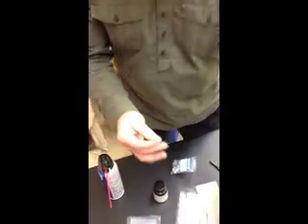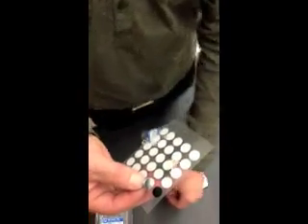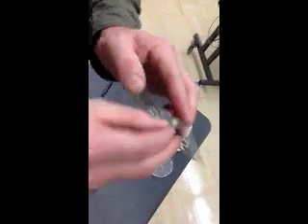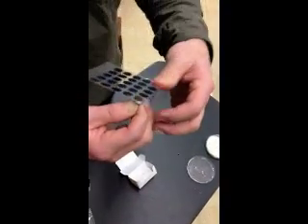One of the techniques is called the carbon tape. You'll take the first layer off. You'll have the carbon tape on one side of the sticky area — it's sticky on both sides. You'll press it down, make sure it's centered over the stub as much as possible, push down really well, and then peel it off.